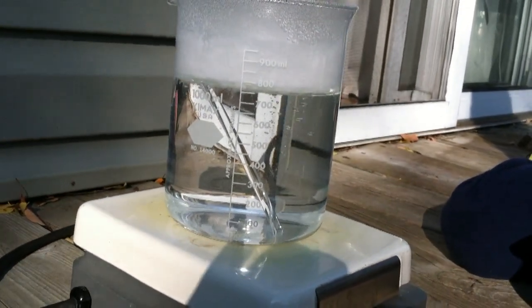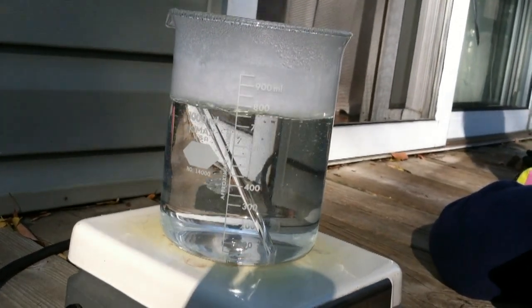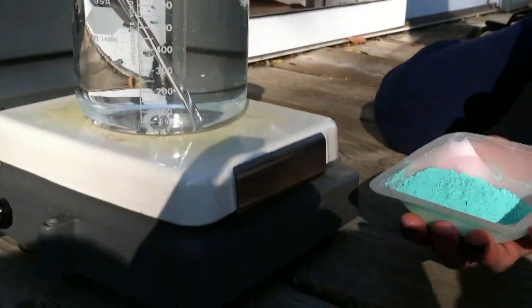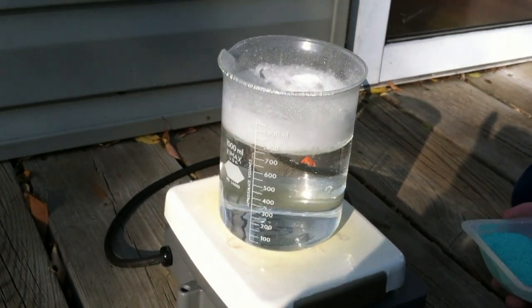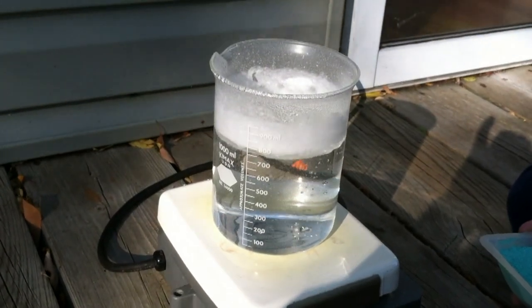Next add 25 to 29 grams of copper 2 carbonate. We are going to start adding it and it is going to fizz and foam, producing carbon dioxide gas.